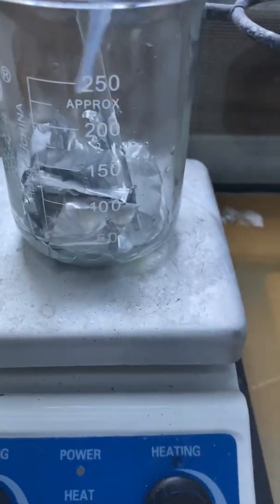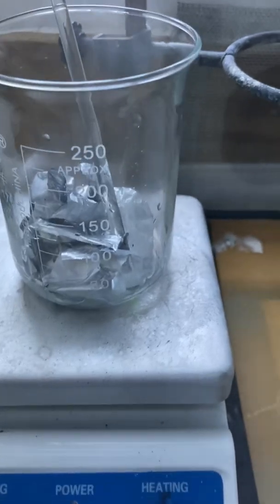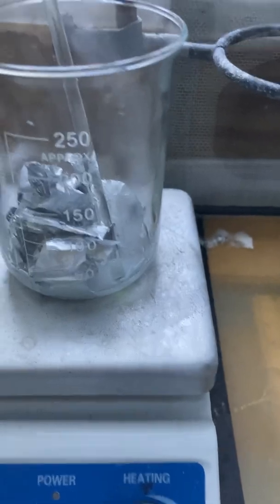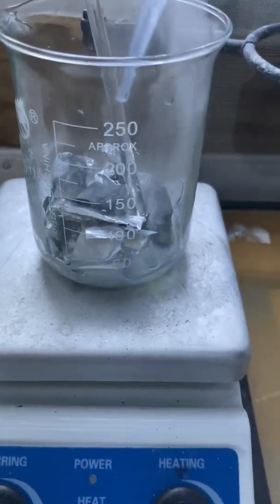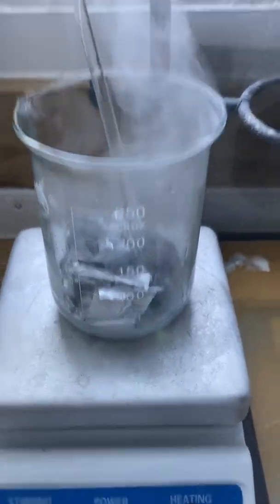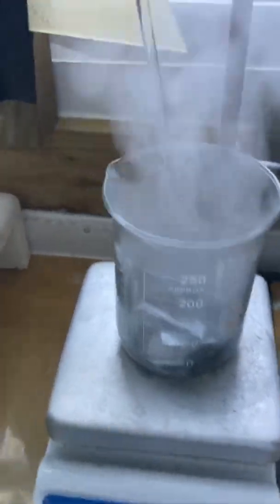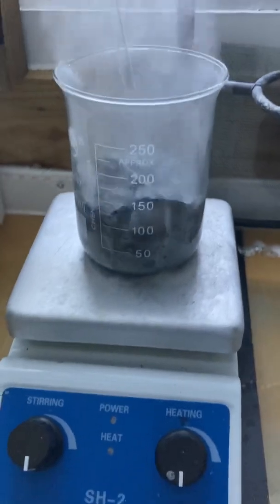As you can see it's starting to go slightly slow at first, but once it gets going it's very exothermic and very fun to watch as you can see.